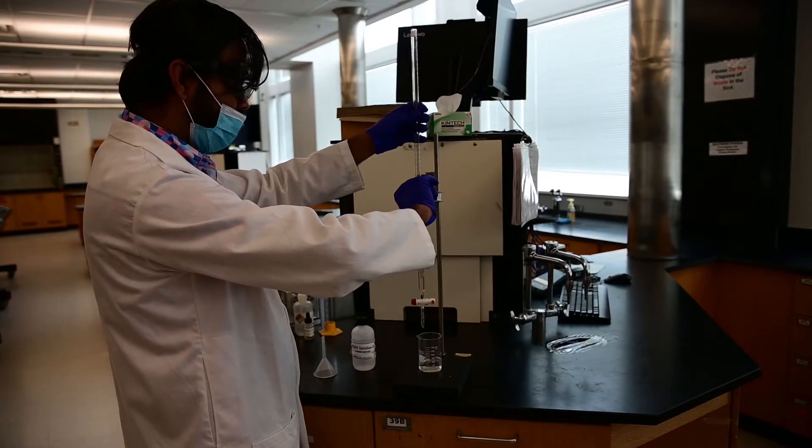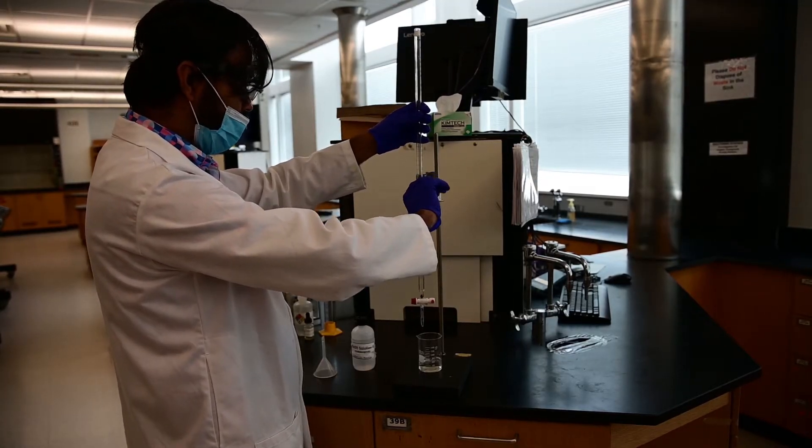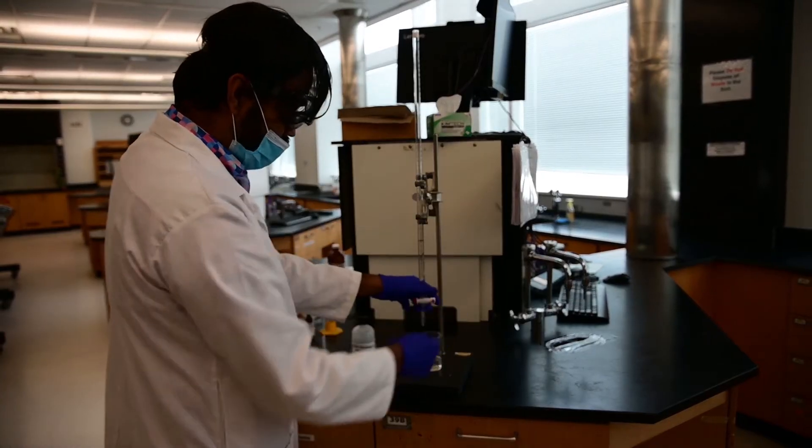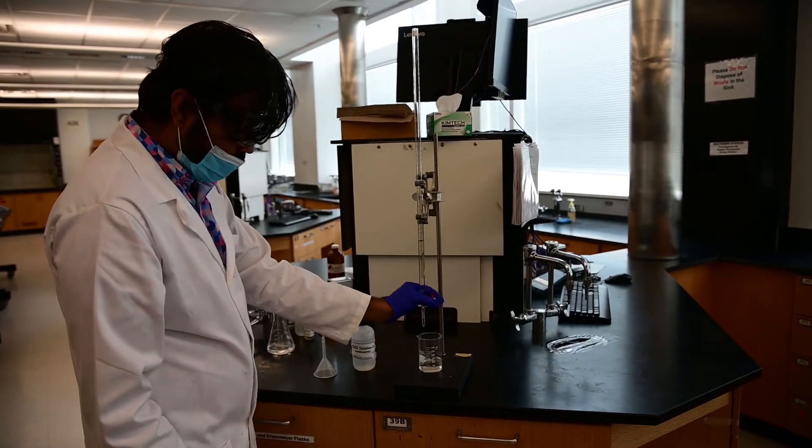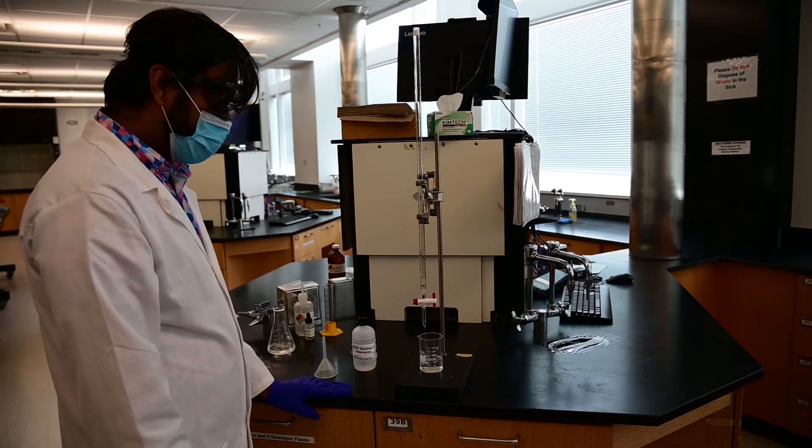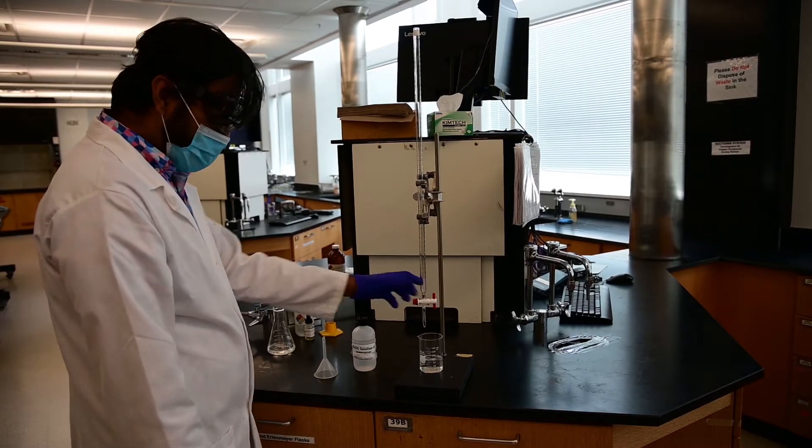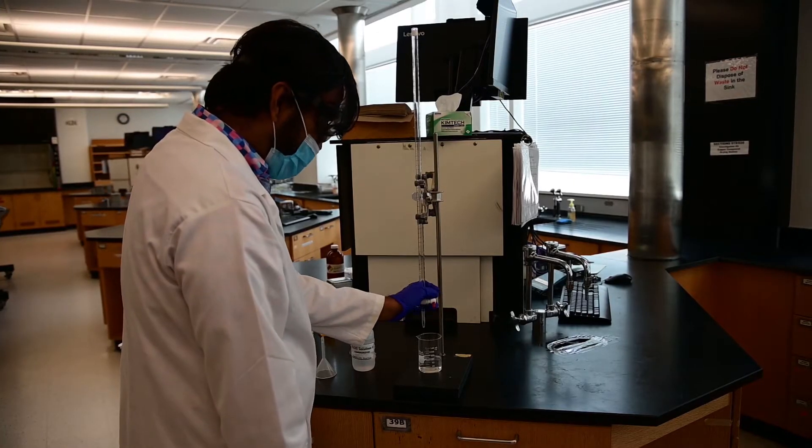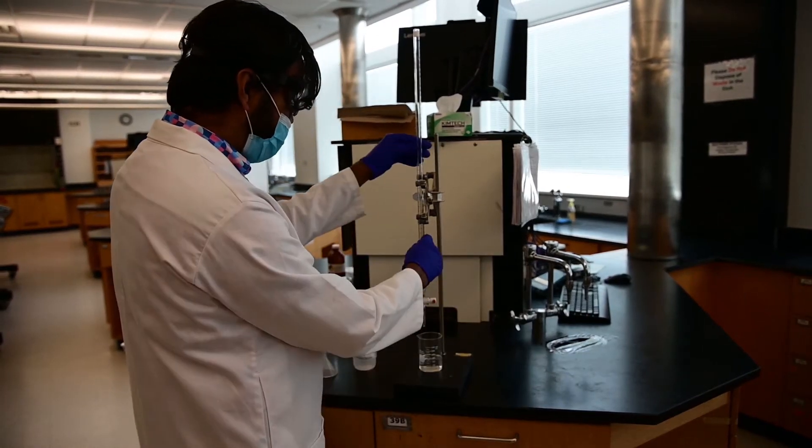Now the burette is washed. Pinch on the tap, on the clamp, attach the burette. Once again, open the tap completely. Now your burette is completely ready for being filled with sodium hydroxide.